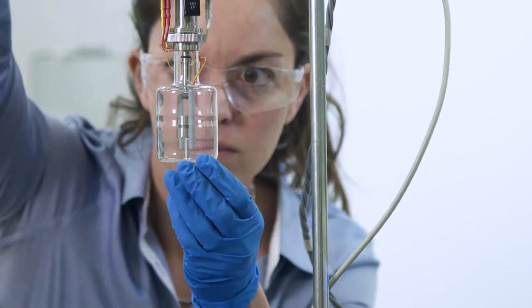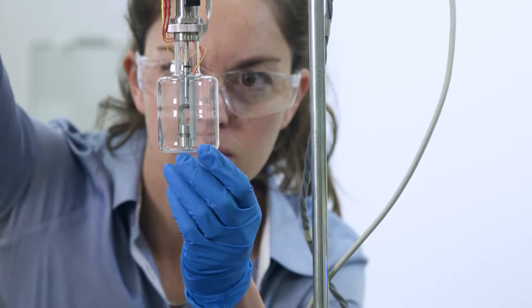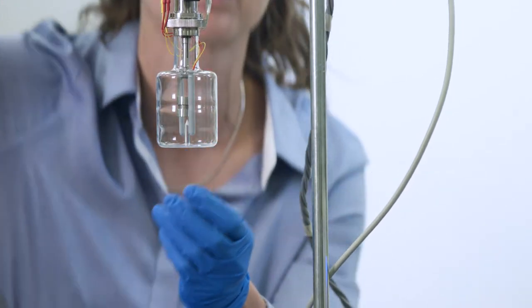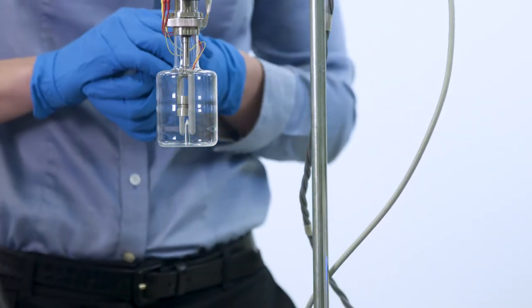The thermistor assembly, also called the temperature plug, is unique to each reaction vessel and measuring temperature. Three temperature plugs are delivered with the SolCal for 25, 35, and 45 degrees Celsius. Other temperature plugs can be ordered for temperatures between 15 and 80 degrees Celsius.